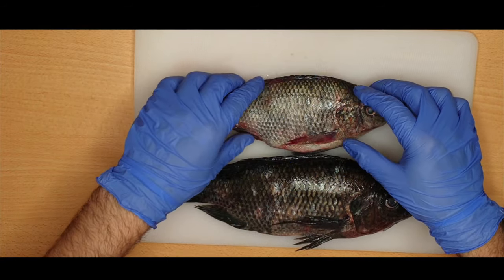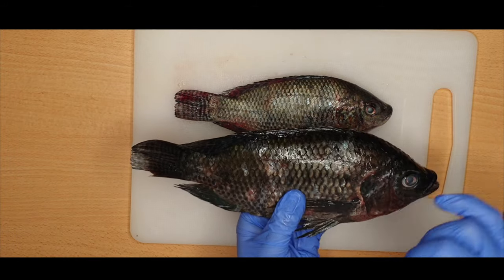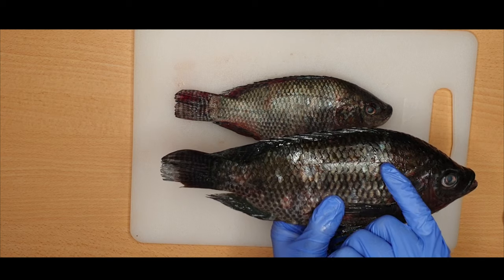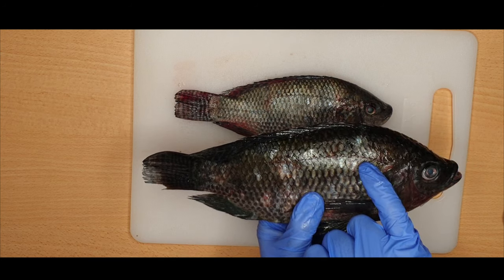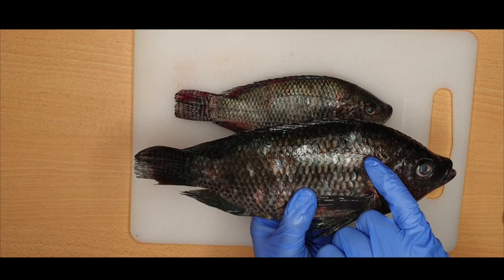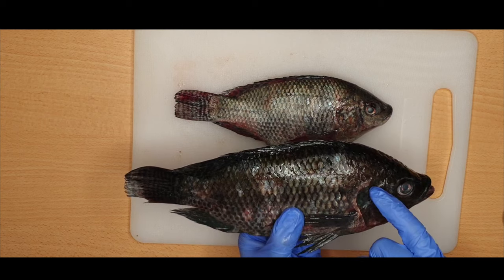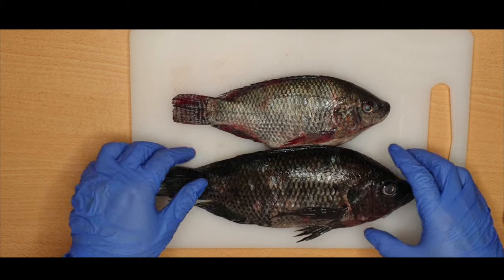There is one more very important external feature: the lateral sensory line. It is sensitive to vibrations in the water. It is a groove along each side of the body with many tiny openings to the outside. It is made up of sensory cells found in the lateral line organ, detecting vibrations caused by waves and other movements in the water, including movements by predators. This is the external feature of the tilapia, which is an example of bony fish.